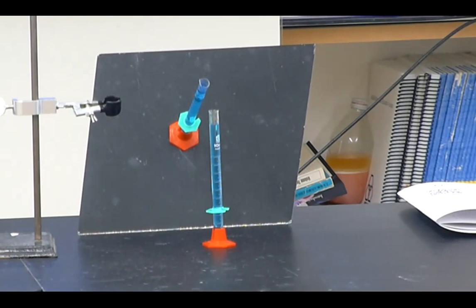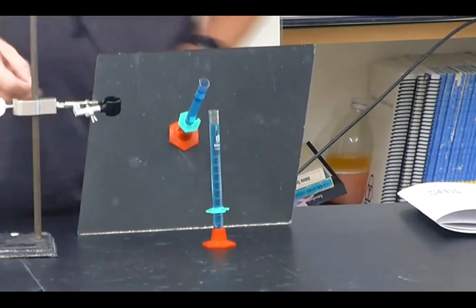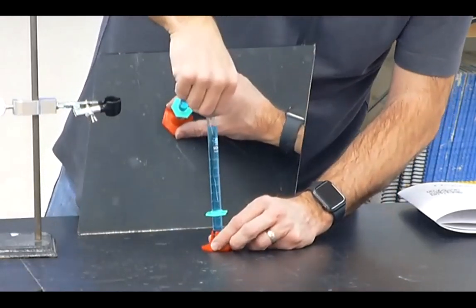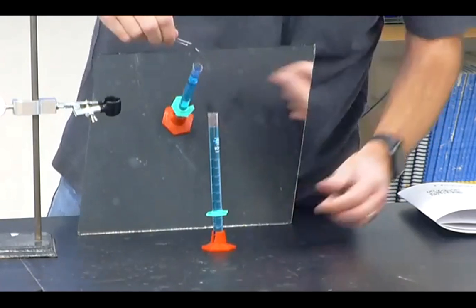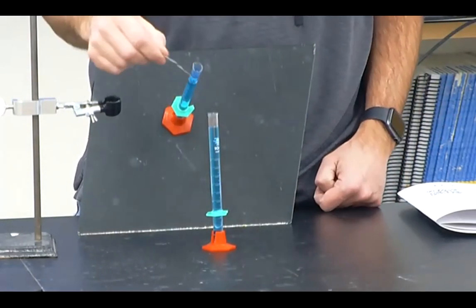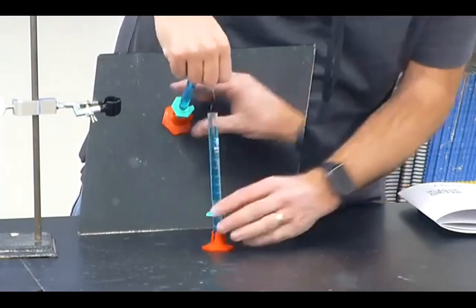All right, so iron, and the blue liquid that you can see right there, that's the copper 2 sulfate. It'll make FeSO4 and copper. So I'm just going to put this in pretty quick, and then I'll take it back out. I don't know if you can see that very well. You see it already turned black. All right, I'll just put that back in and leave it.